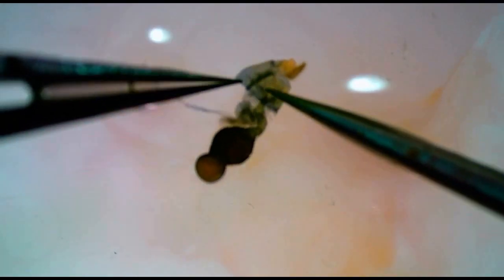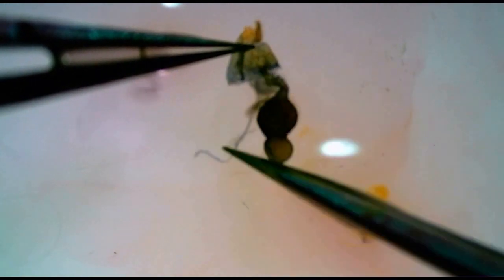Sometimes the corpus bursa has excess stain or spermatophore trapped inside. To solve this, you can make a small incision in the wall of the ductus bursa to physically remove the spermatophore or let the excess stain out.